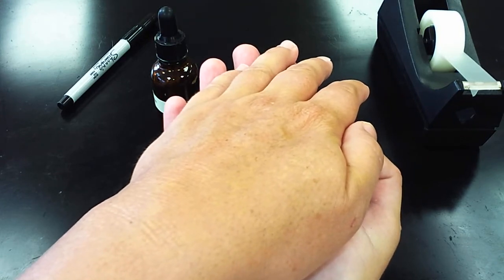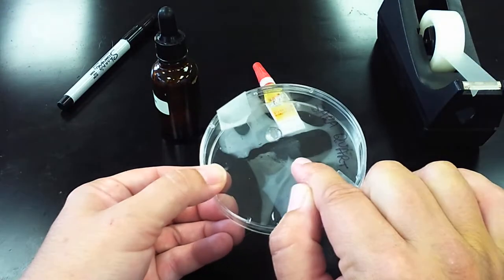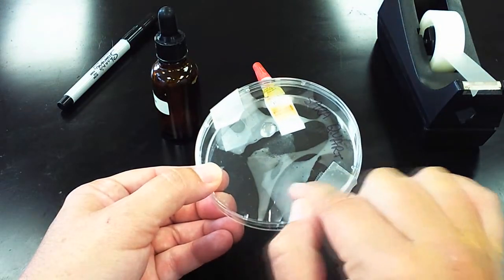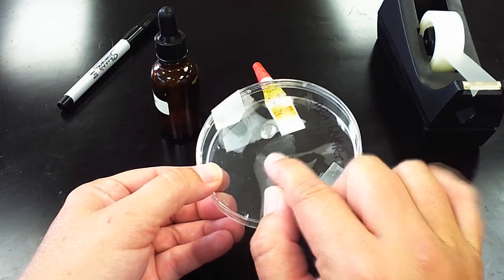After about ten minutes, you can take a look and you should be able to see your fingerprint on the lid. There's a lot of heat and humidity in the room, so I have a lot of moisture in here. But after ten minutes you're going to have a really great print there.